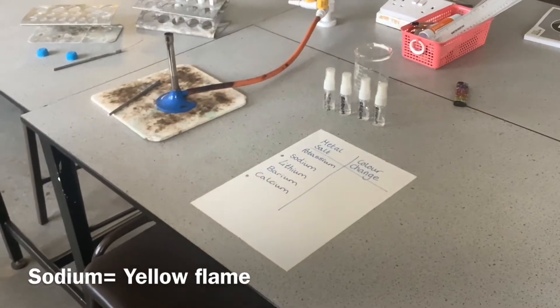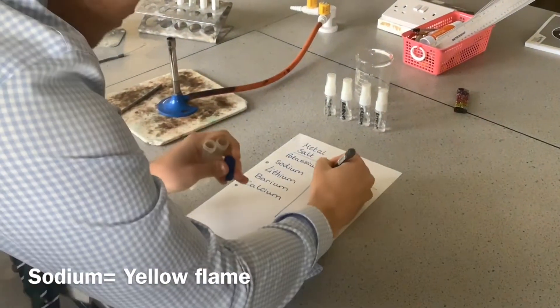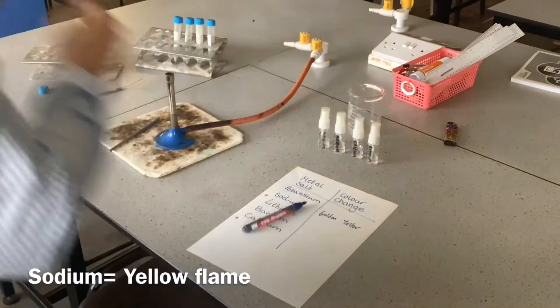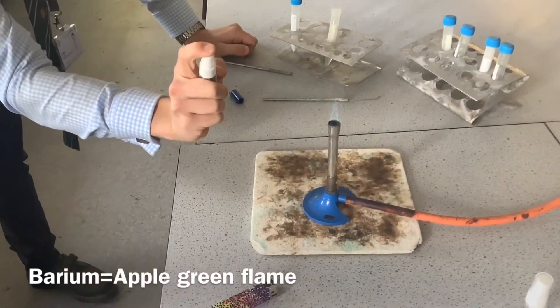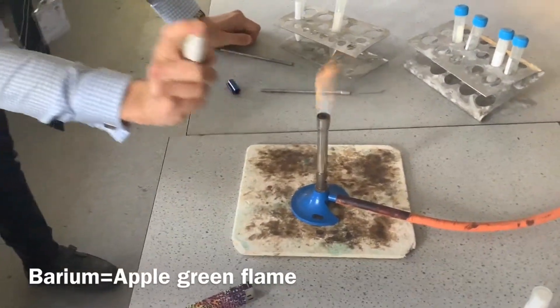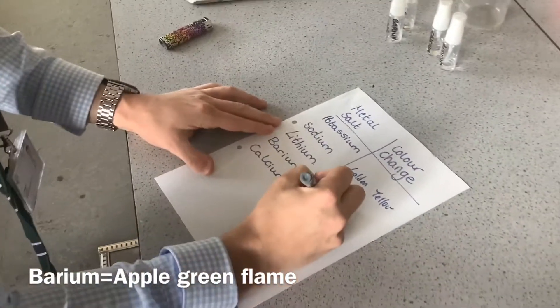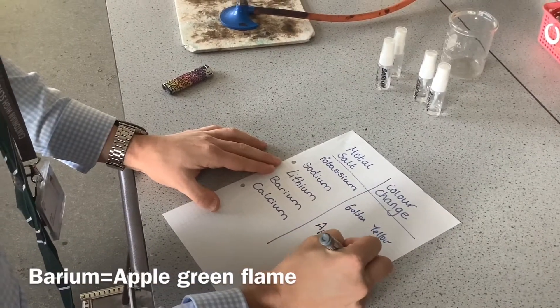I'm going to write down yellow. The key terminology is golden yellow — that's what we're looking for. Golden yellow is important. So we've seen barium and it's apple green. That is the colour it should come out. Into my table of results we've got apple green — make sure we're saying apple green.